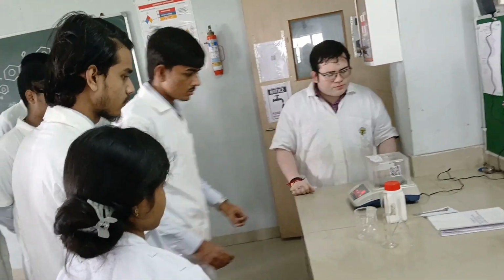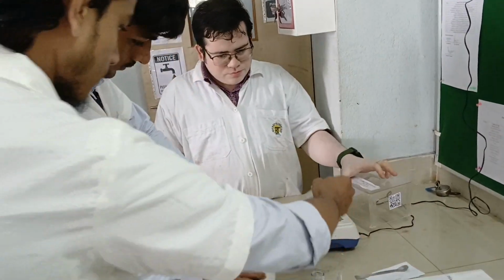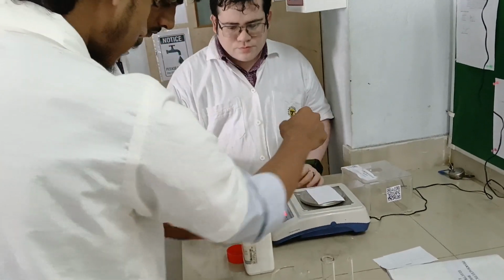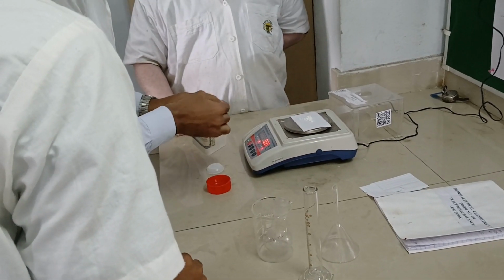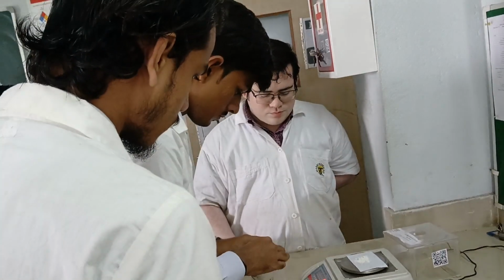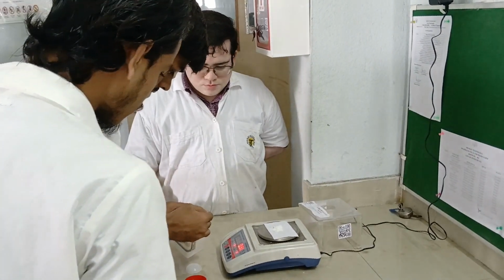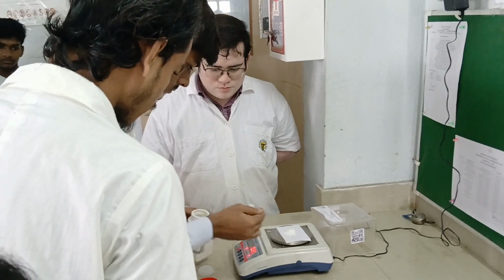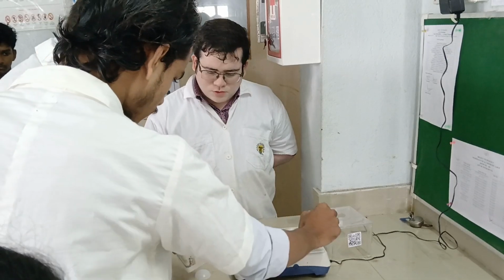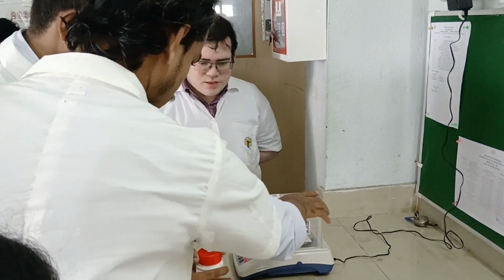Okay, at first weigh about 1 gram of benzoin. Now take it in the RBF.